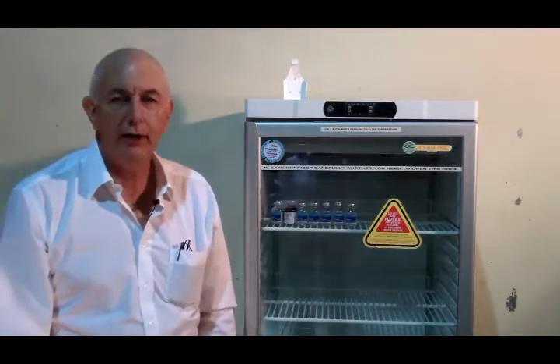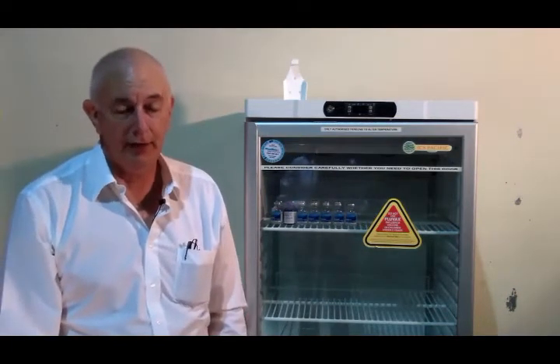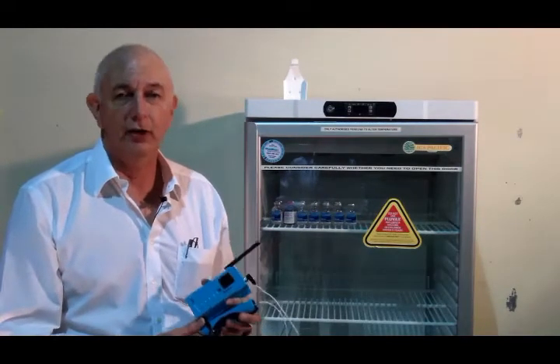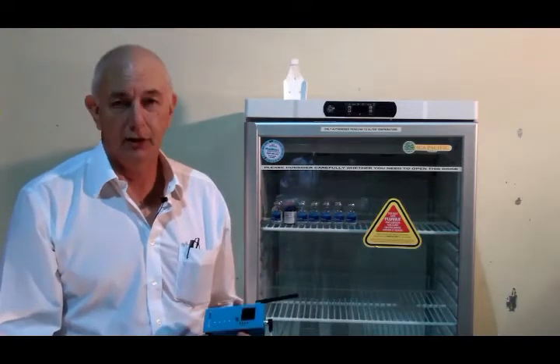Hi, I'm Len from HLP Controls. We're here today as part of a series of videos to show you the installation procedure for the Sensei Scientific B10 node data loggers.